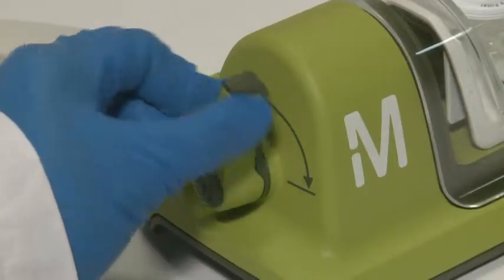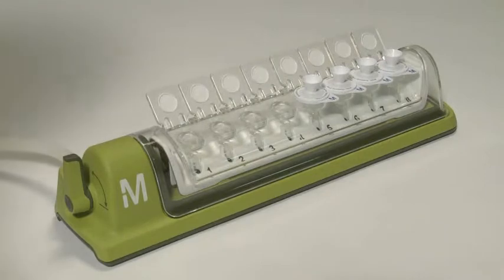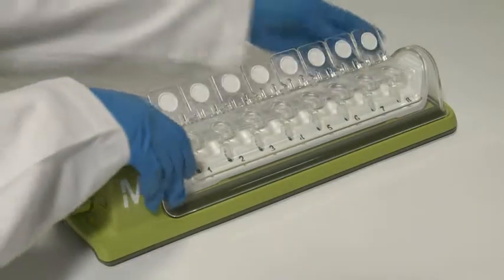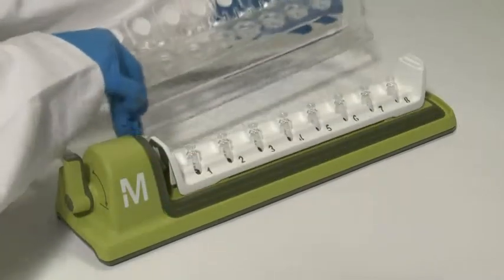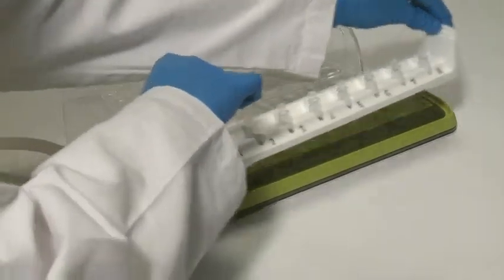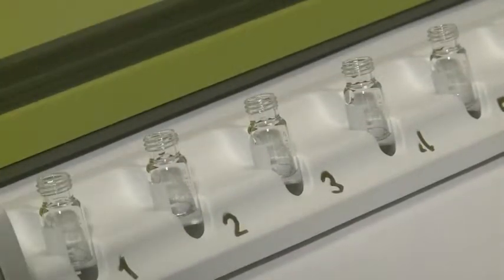Turn the vacuum off and wait a few seconds for the vacuum to release. Dispose of the filters and remove the cover. Your samples are now particulate-free and ready for analysis.